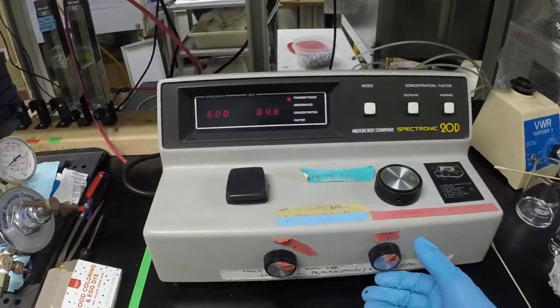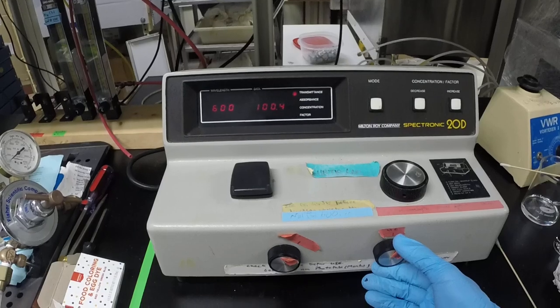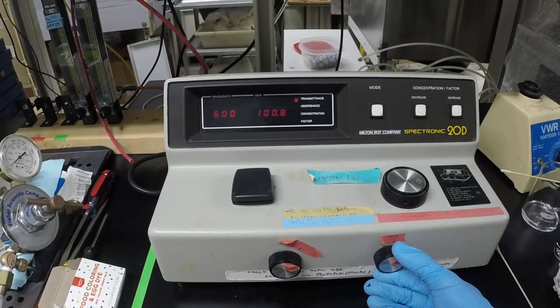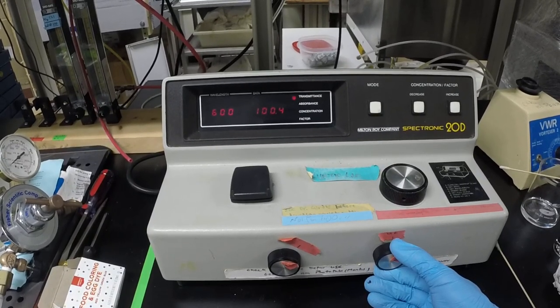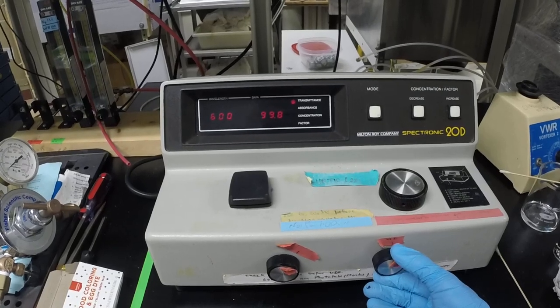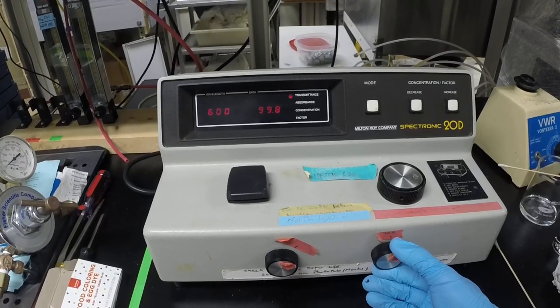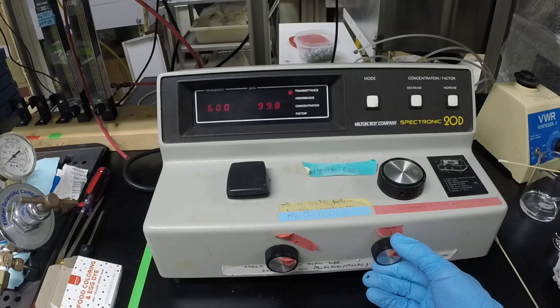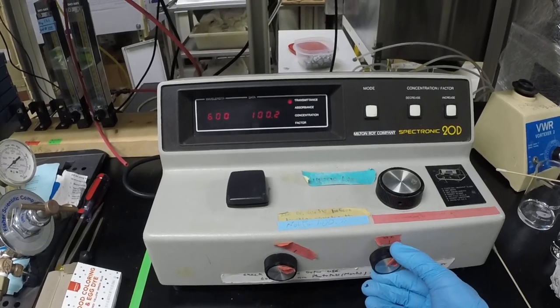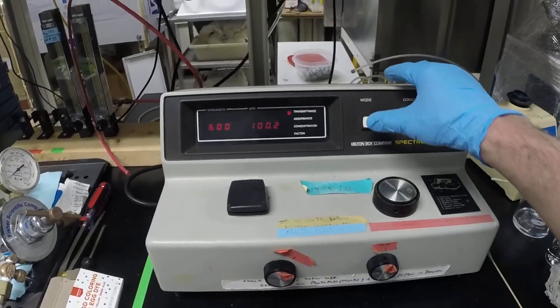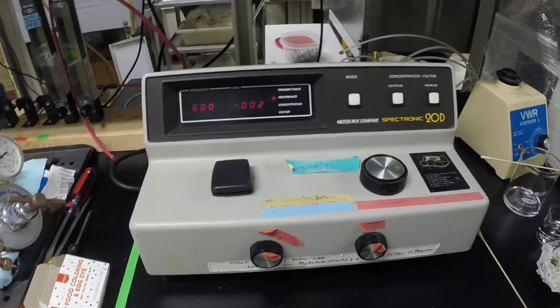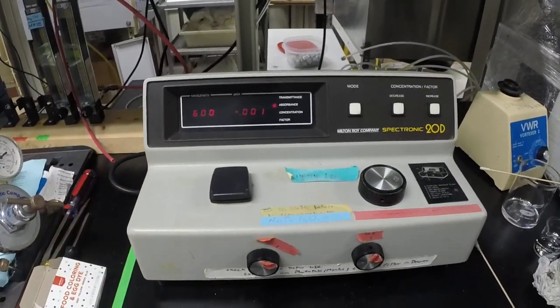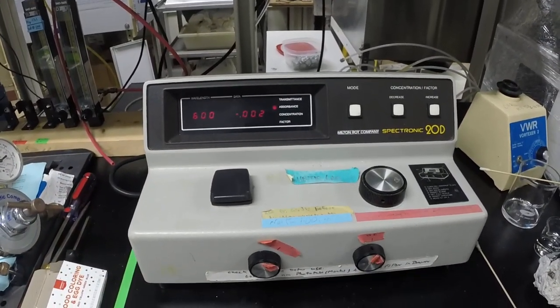Putting that back in, checking for the span, and then you actually take, at this point since I'm interested in measuring absorbance, you can take this, and you change the mode then to absorbance, and you can see now the absorbance is essentially 0.002.